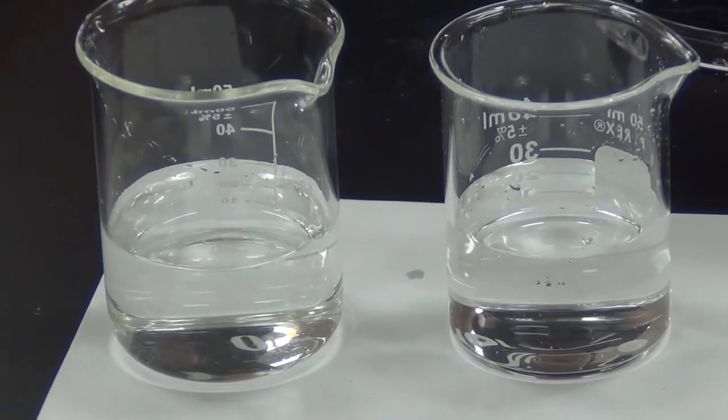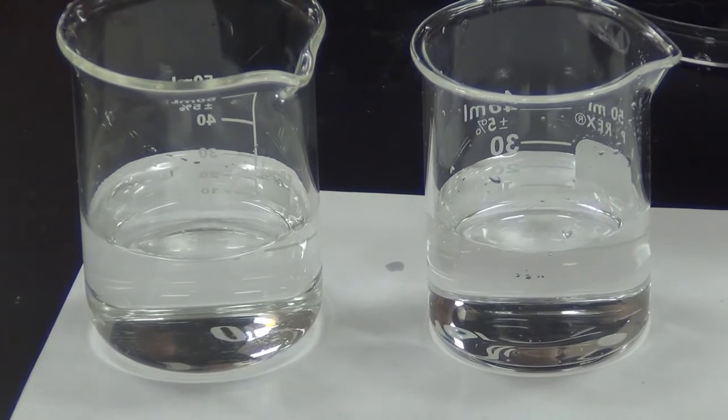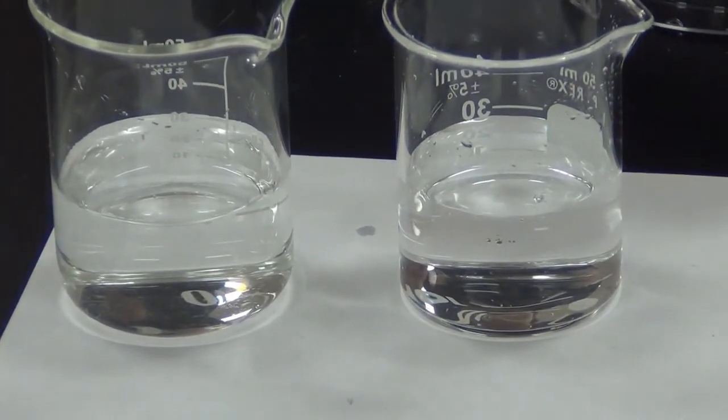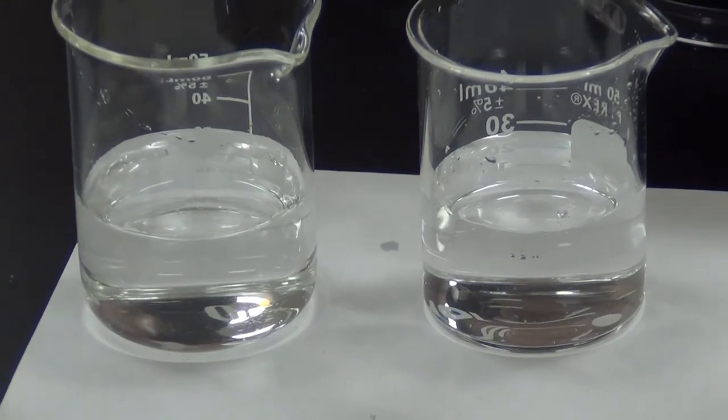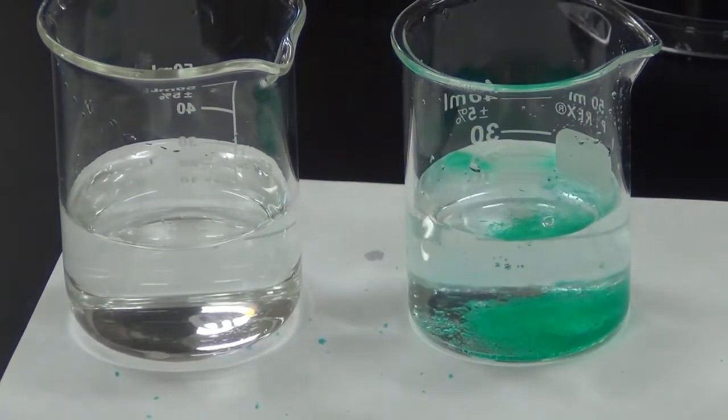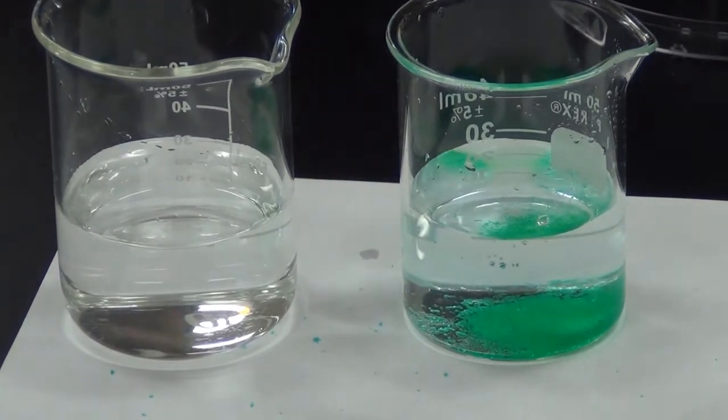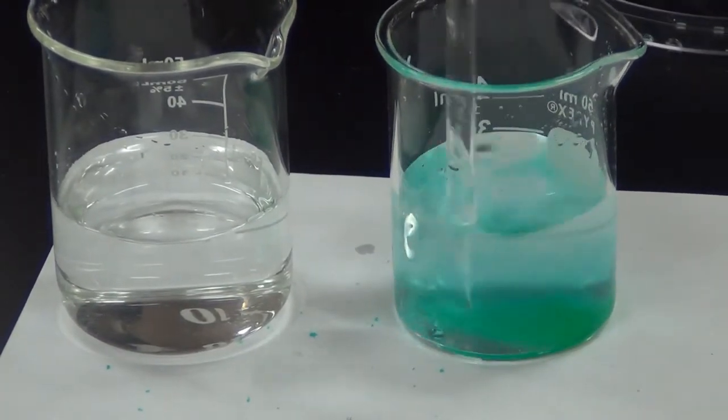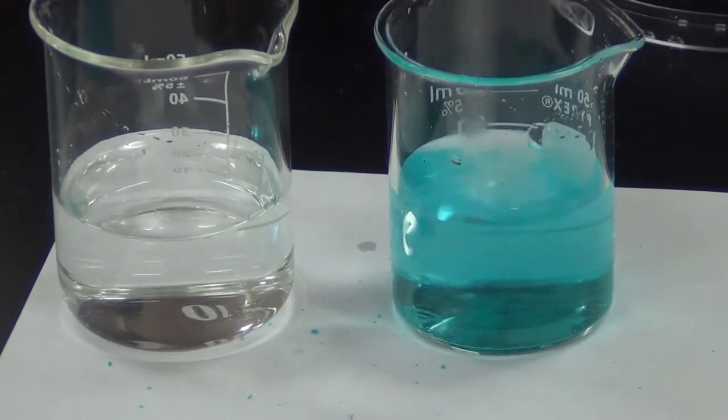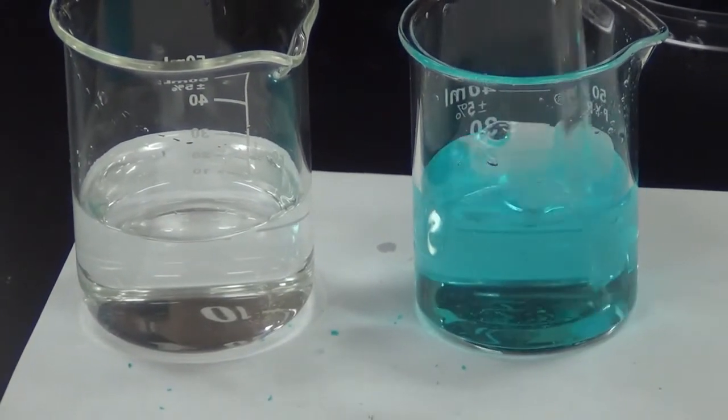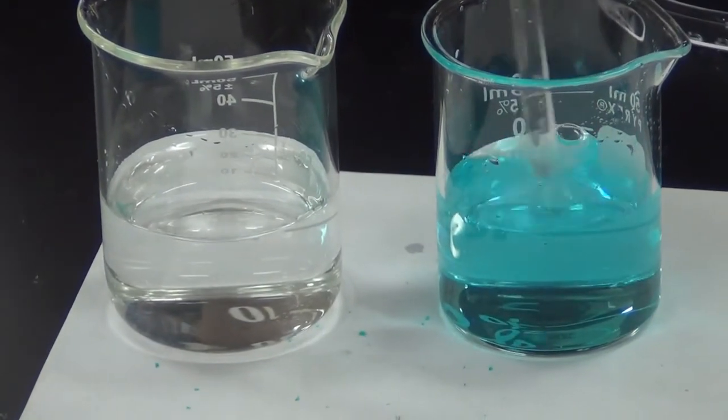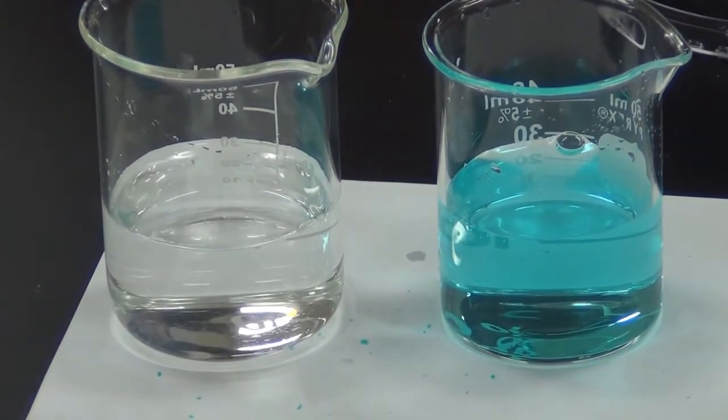In San Antonio we have very hard water because we get our water from the Edwards Aquifer. That means the water from the sink has dissolved carbonate ions in it. Most carbonates are not very soluble and that includes copper carbonate. You can see I can take a scoop and put it in the deionized water, and you can see it very quickly dissolves and makes a pretty clear blue solution.